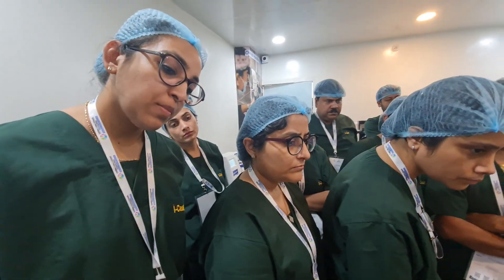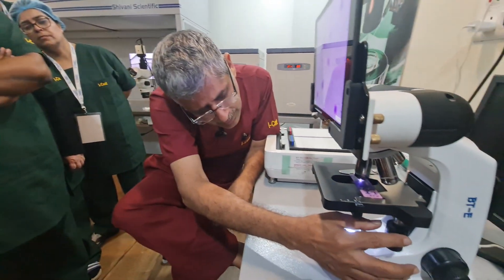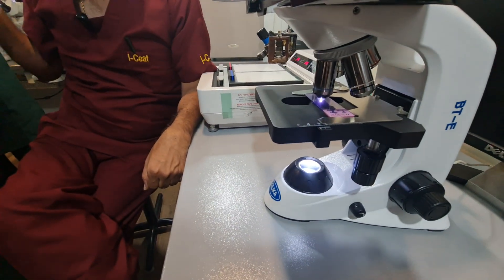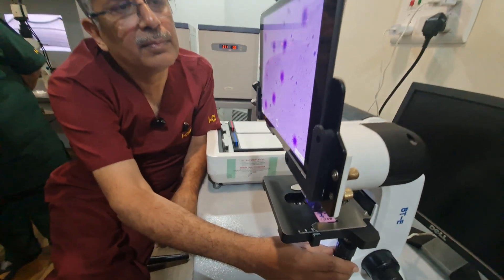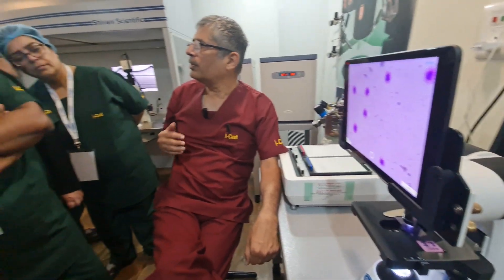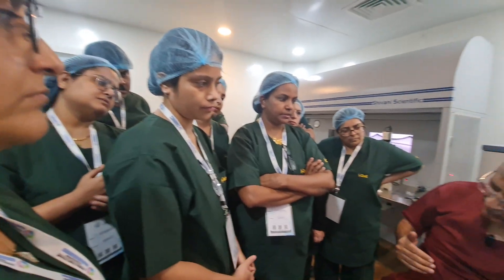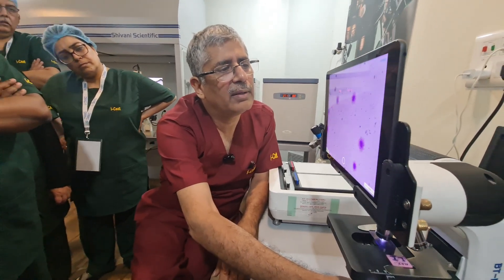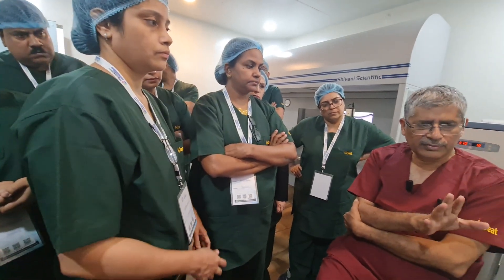In case I am seeing a sperm here and I want to bring it to the center, I use the stage controls. The lower one moves the sperm left and right; the upper one makes the sperm go up and down. Lower 'L' stands for left and right; upper stands for up and down — otherwise you'll get confused. So very easily you can move the sperm in any direction. That's the way these microscopes work — the basic simple microscope.